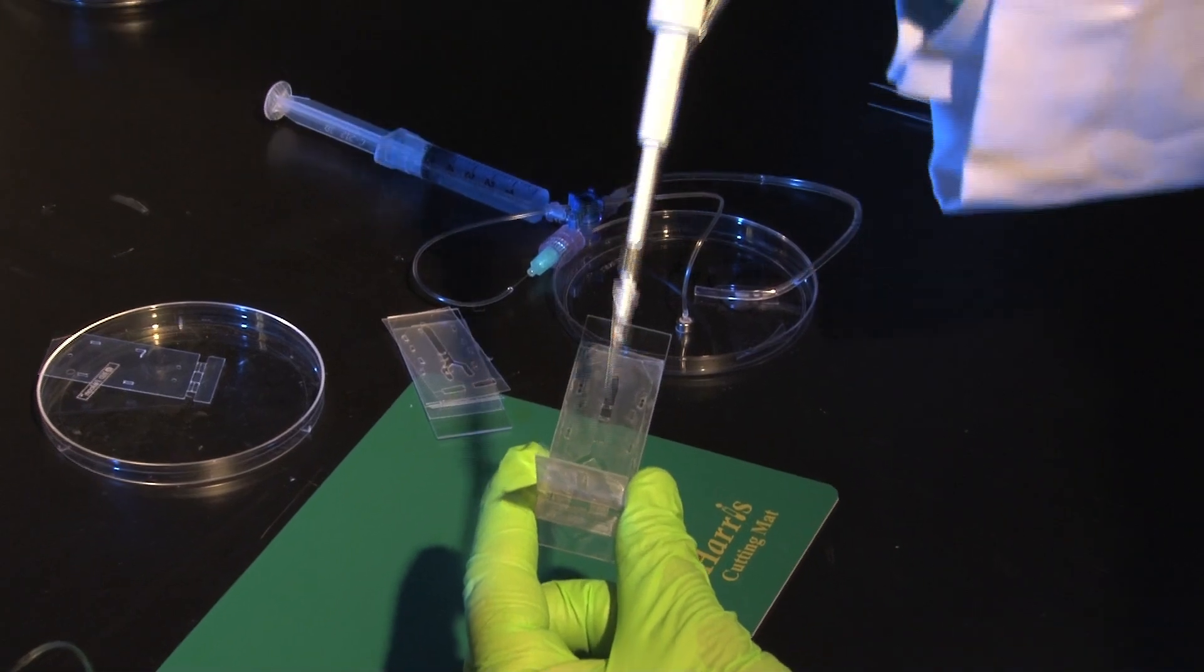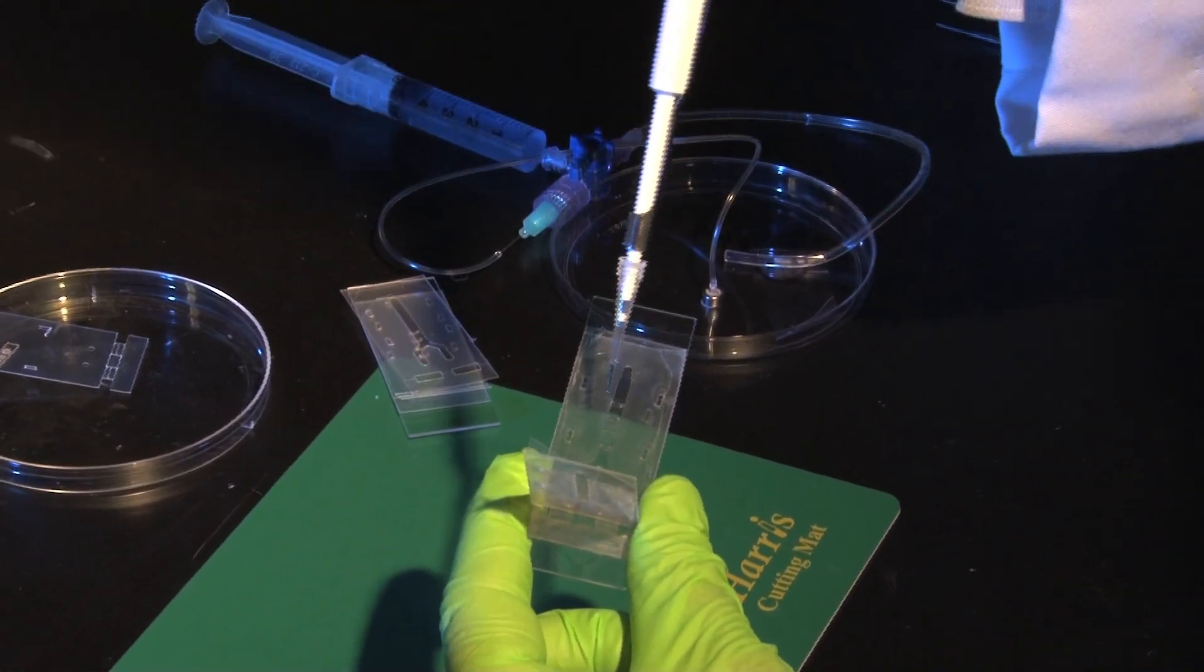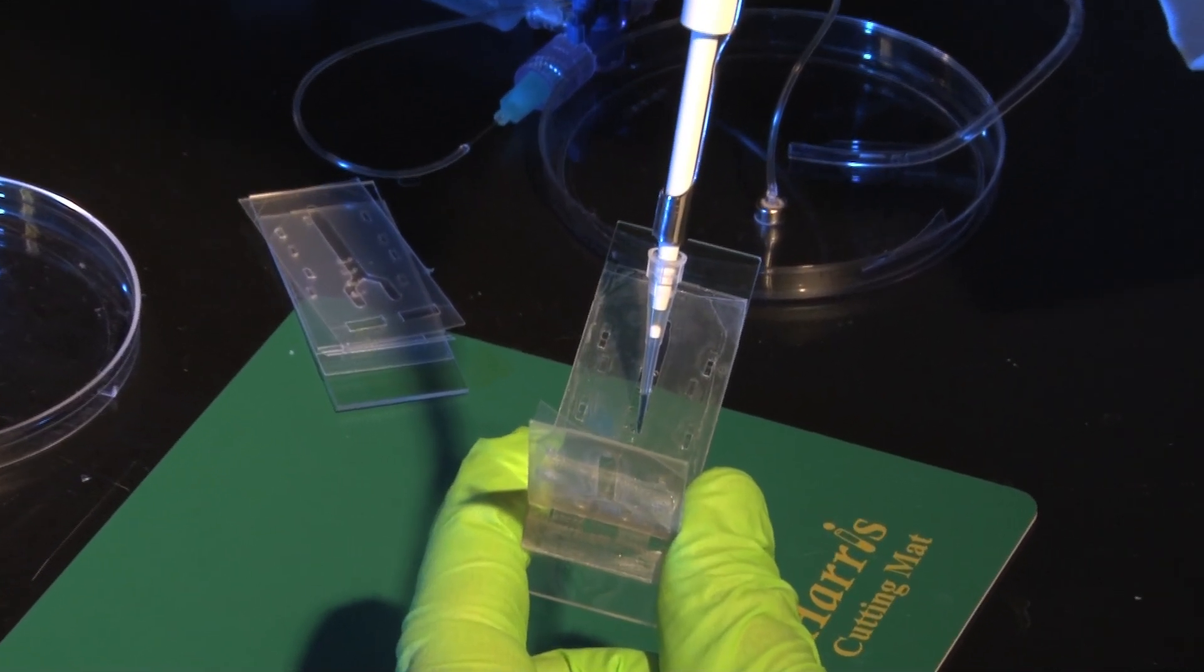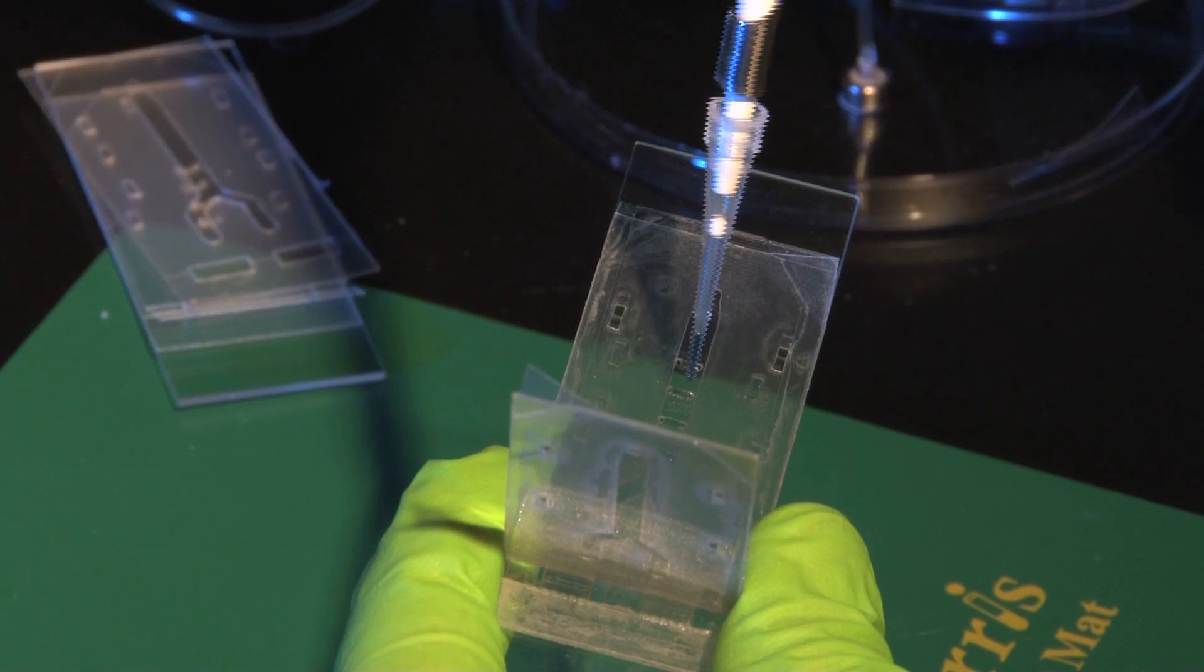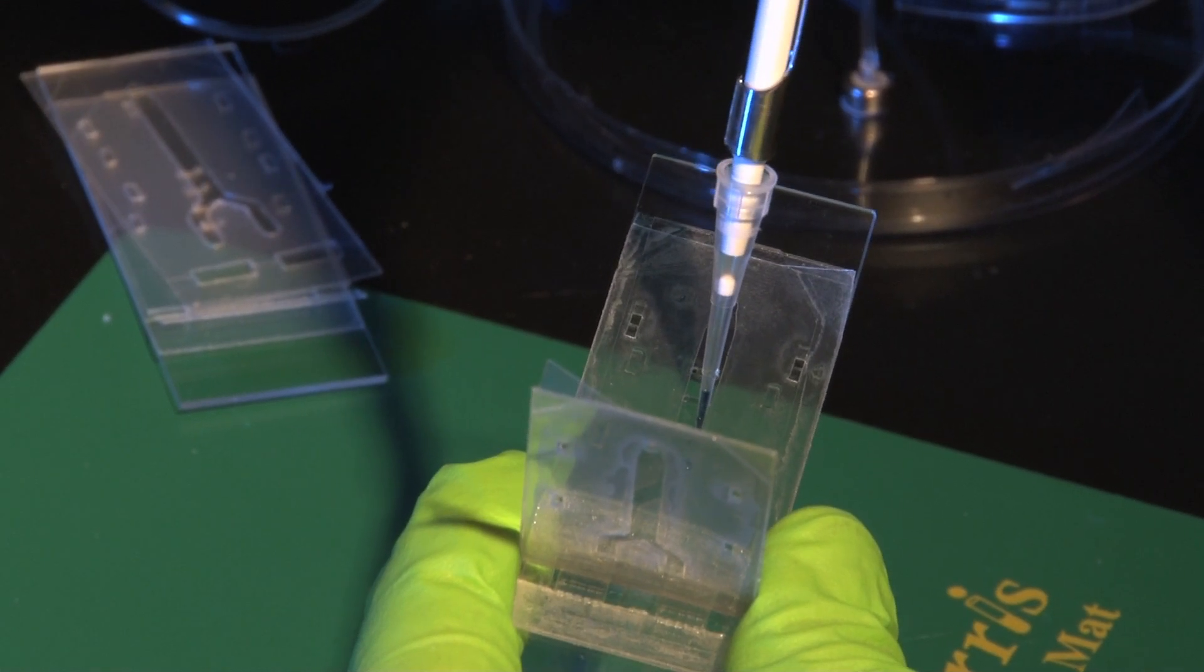In this case it's very simple because the chip is open so you can access it directly with the pipette. So you come here, you just need to press it and it goes all the way through. You can do it with the other channels as well.